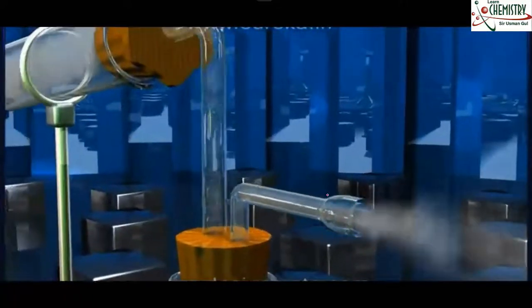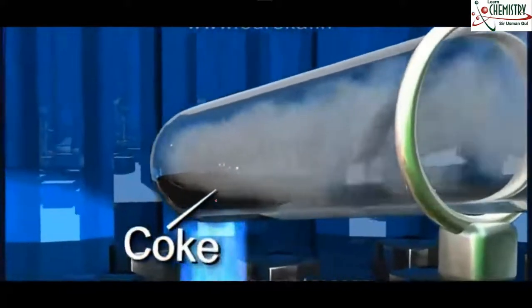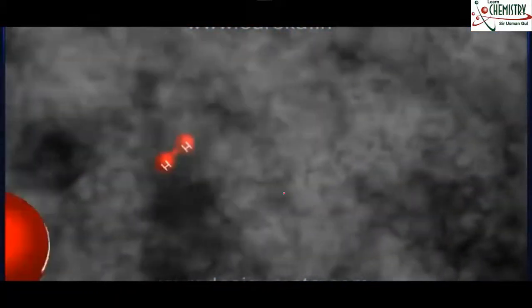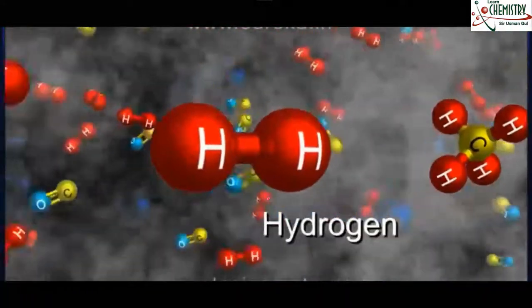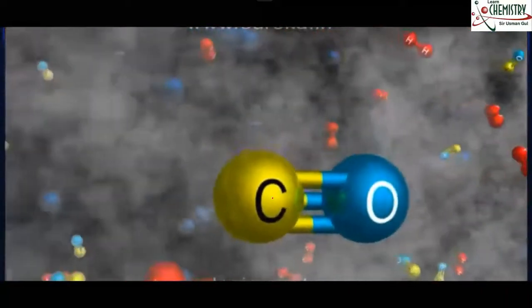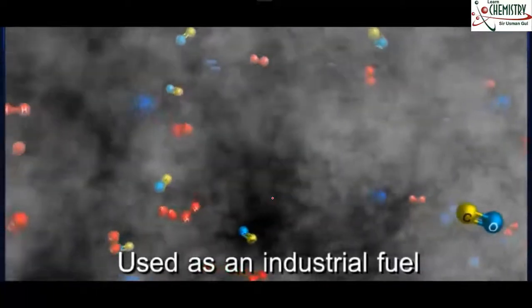Okay, now what happens when all the vapors are removed by the heating? The residue is called coke. Okay, now remember that this coal gas is composed of, number one, methane, second, hydrogen gas, third, carbon monoxide gas.